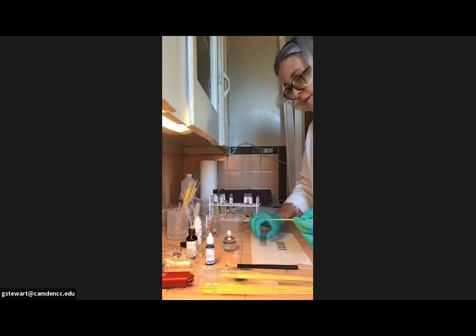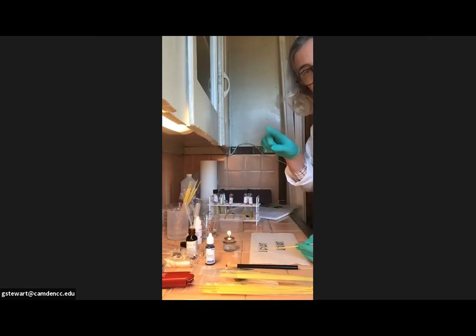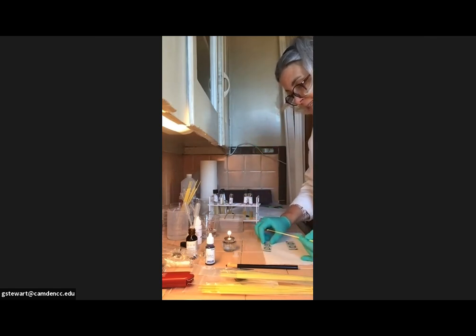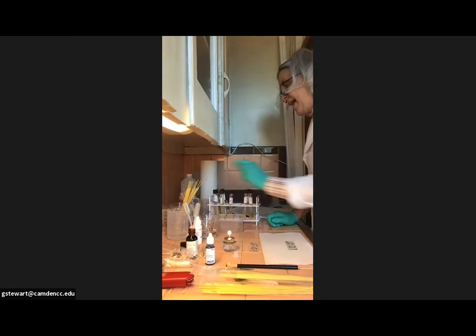And then I'm just going to simply mix my E. coli in my A circle with the distilled water that I already put in there. It's important that I just mix like this, no smacking. Smacking will put the bacteria into the air and we don't want that. And tap a little bit. And then again, this is still potentially full of E. coli, so I'm going to drop that into my ethanol jar.